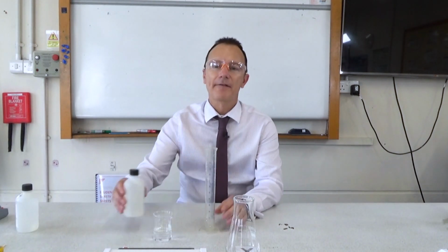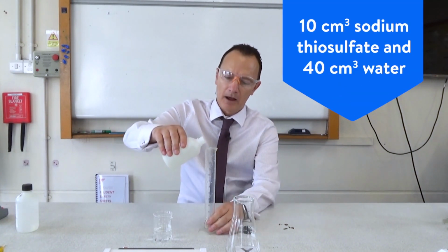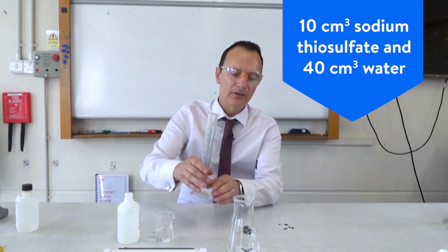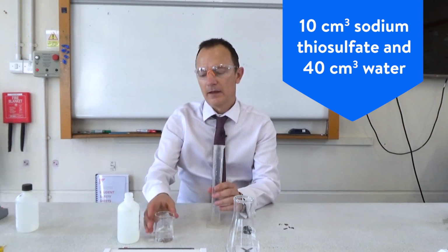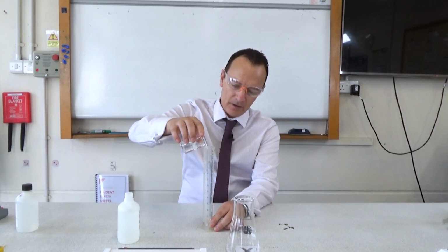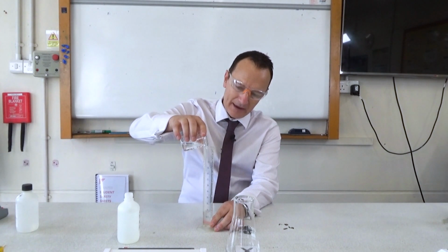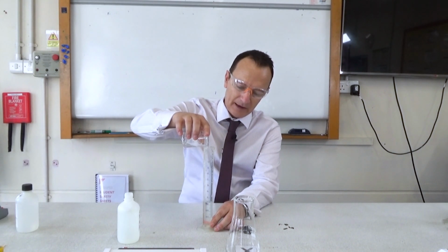The first time I carry out the reaction, I'm going to measure out 10 centimeters cubed of the sodium thiosulfate and add that to the flask. And then I'm going to add to it 40 centimeters cubed of water. This is just water in the beaker, and that's going to dilute the sodium thiosulfate. So each time I'm making up a sodium thiosulfate solution with a volume of 50 centimeters cubed in total.